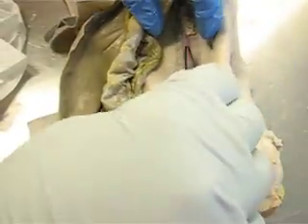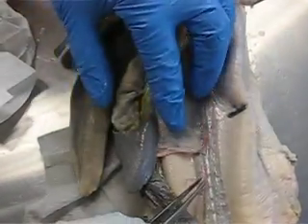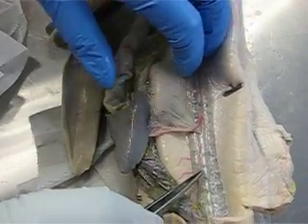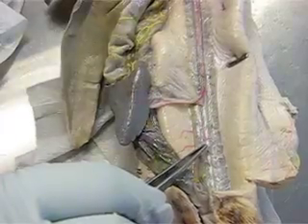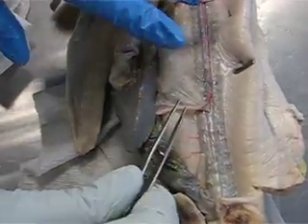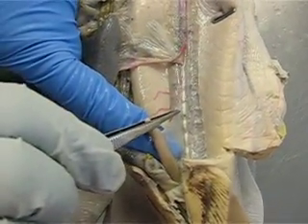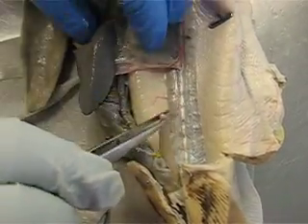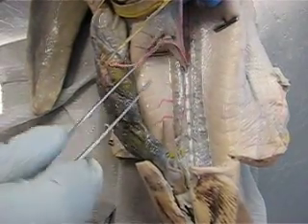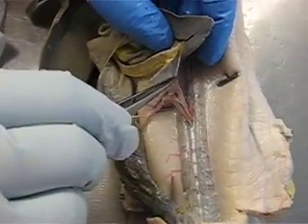Running along the back side here, we have our dorsal aorta. And this is the posterior mesenteric artery. This one is the anterior mesenteric artery, and this one is the gastrosplenic artery.